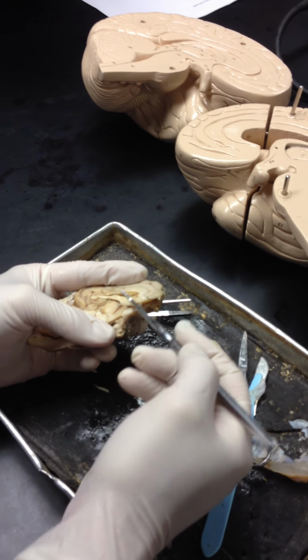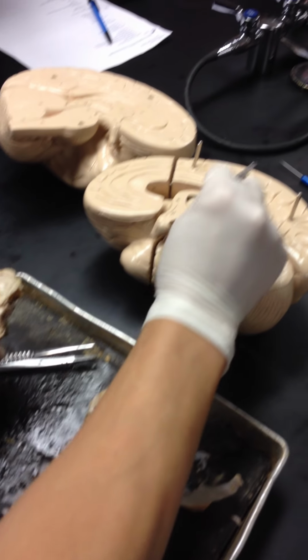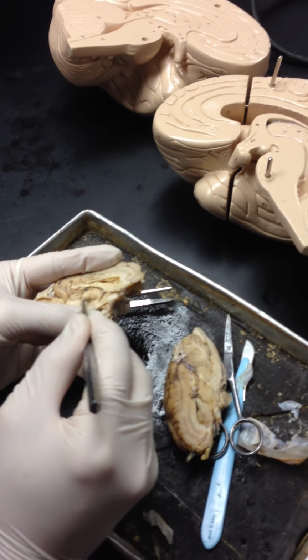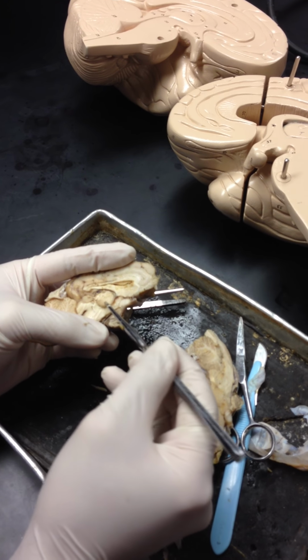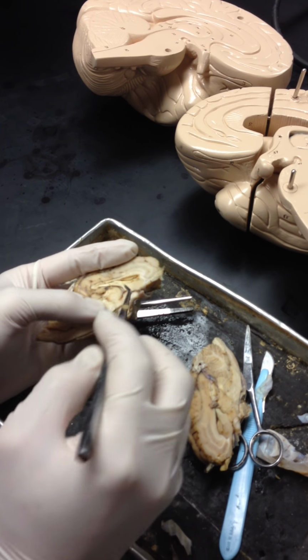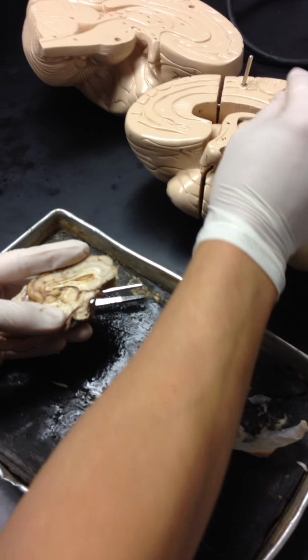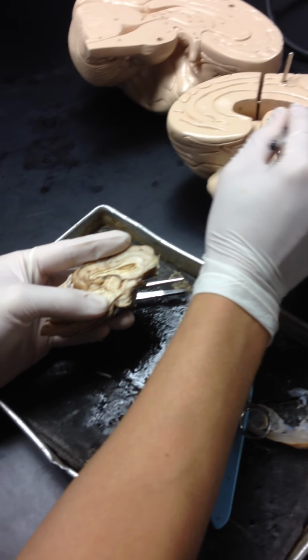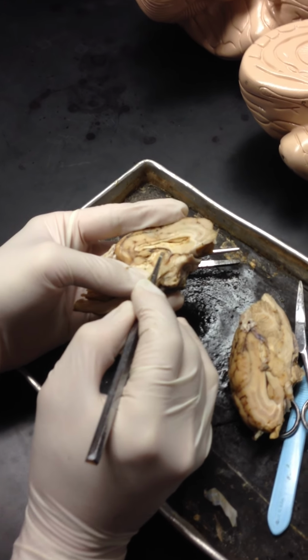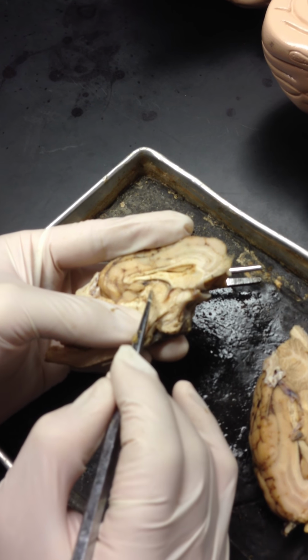Now what I want to do is this: move down. This is known as the thalamus. This whole thing is called a thalamus. This is a piece of tissue of something else. I'll come back to it. And this is the intermediate mass, that little button in the middle. You can see the intermediate mass right here. See this? See that? All right.